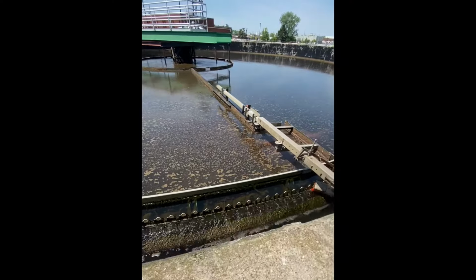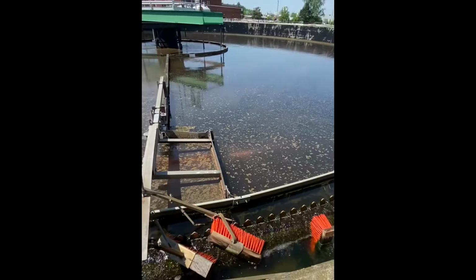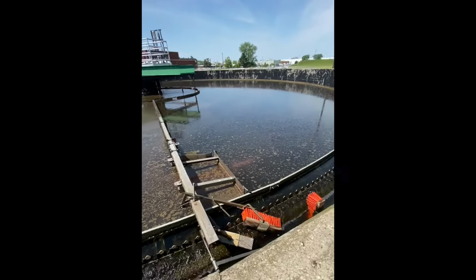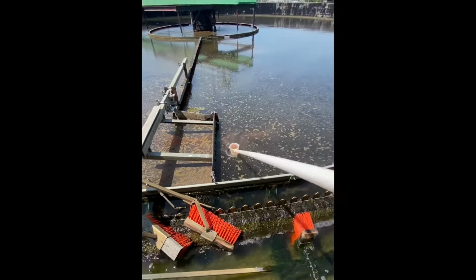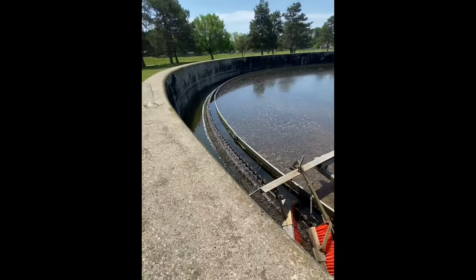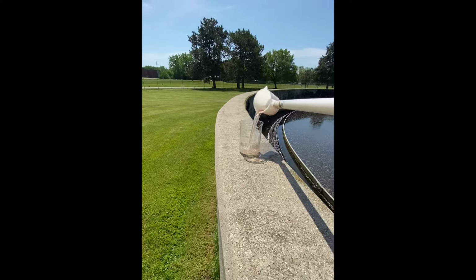Now, as I was looking closely at the system, I saw a red cloud. And normally we would think some floc particles, but because it's red and they appear to be moving, something has piqued my interest. So I'm going to take a sample here, reach into the system, get my sample carefully while I'm trying to video, and we're going to dump that in a beaker.